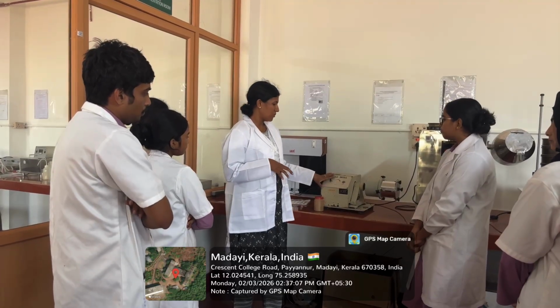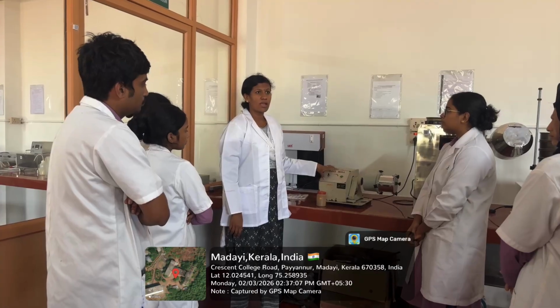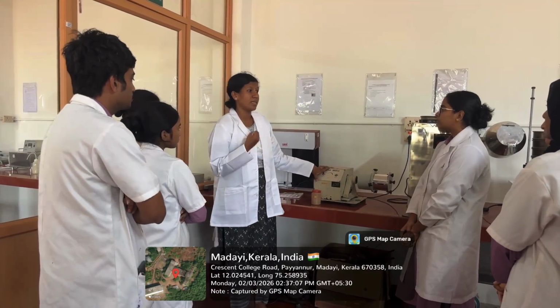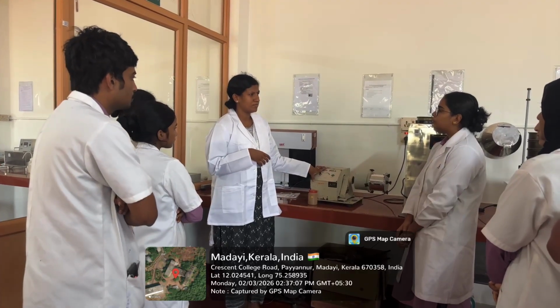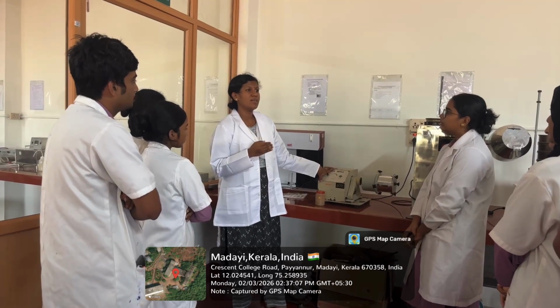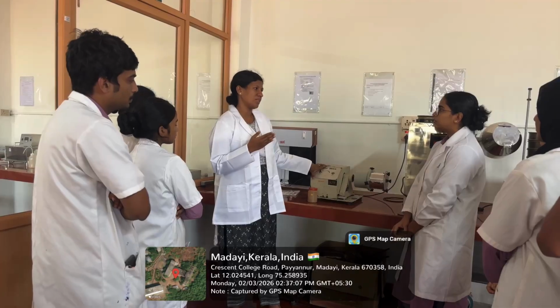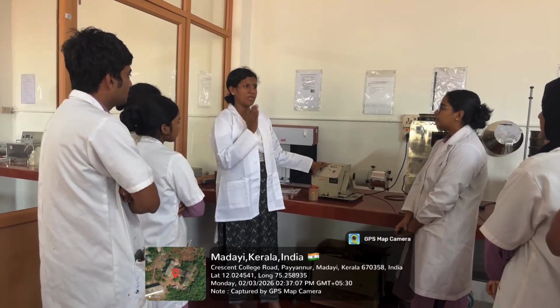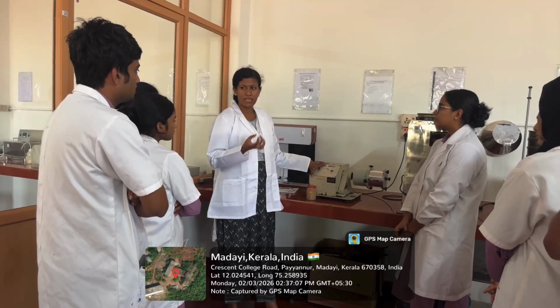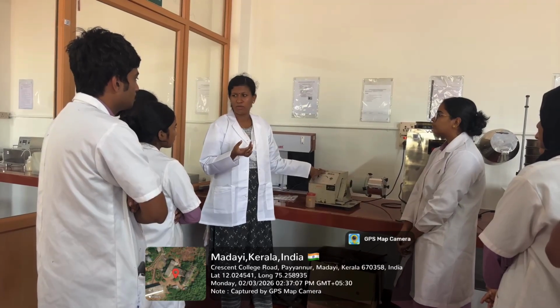In the procedure, we first conduct the size reduction of the powder sample. How will we analyze whether size reduction is achieved after using the ball mill? Size analysis by sieve shaker. We will analyze the size of the powder sample by sieve analysis using the sieve shaker equipment, which was covered in the previous lab. We have already conducted the sieve analysis experiment, and we get the calculated arithmetic mean diameter, surface mean diameter, and volume diameter of the given powder sample.